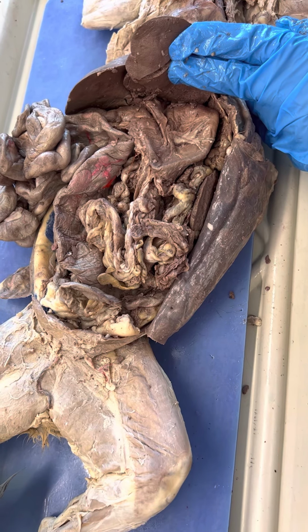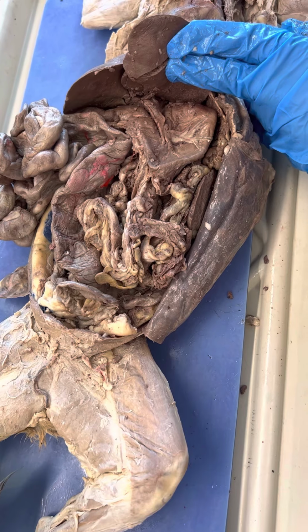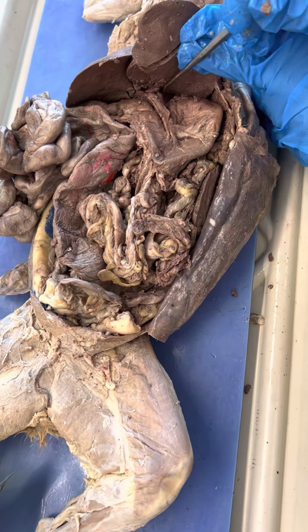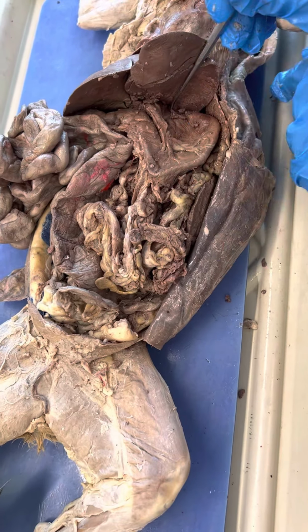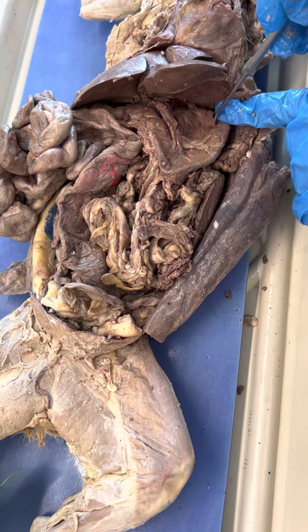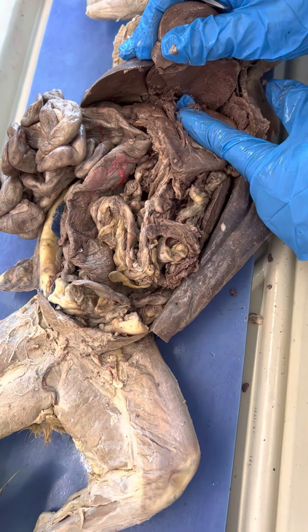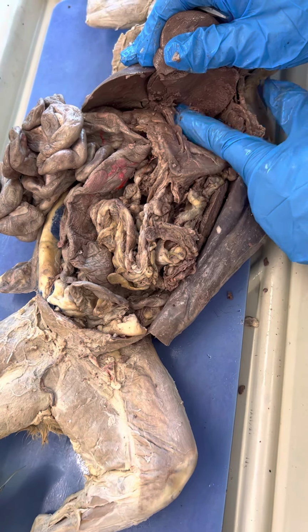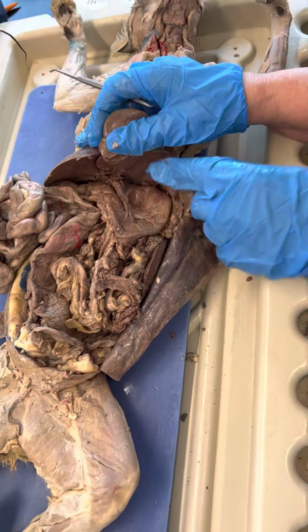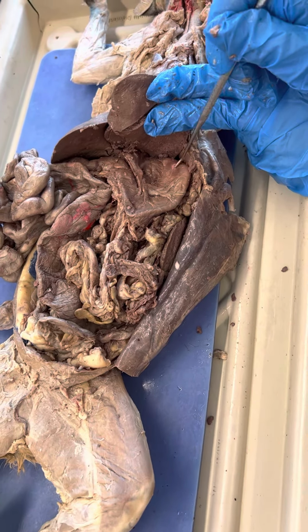So you can have the fundus of the stomach, cardiac stomach. Your cardiac stomach is all the way up at the very top. Your fundus is this bulge. People who get gastric bypass, what they do is they separate that so that they get full fast. So cardiac is at the very top. The bulgy area here is the fundus.